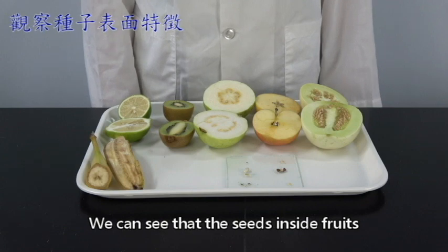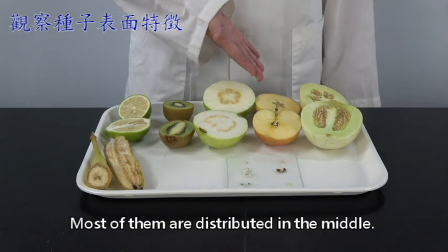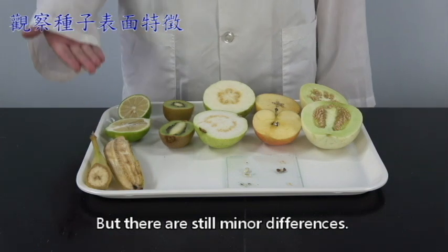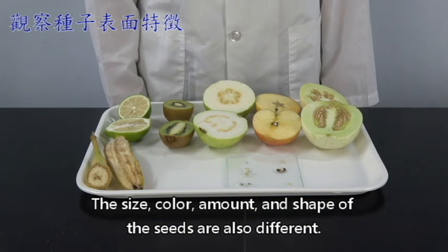We can see that the seeds inside the fruit have different distributions. Most of them are distributed in the middle, but there are still minor differences. The size, color, amount, and shape of the seeds are also different.